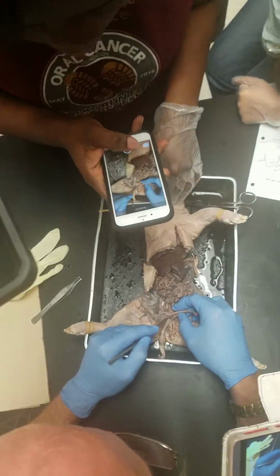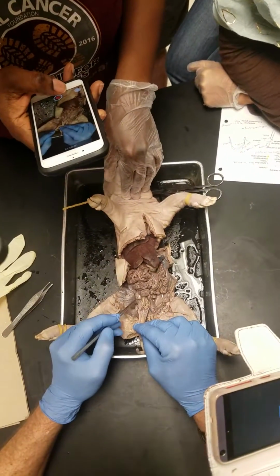Site. I'll just trim it. Can just one person video it and one person send it? Okay, this female is real fast. All right, you start here.